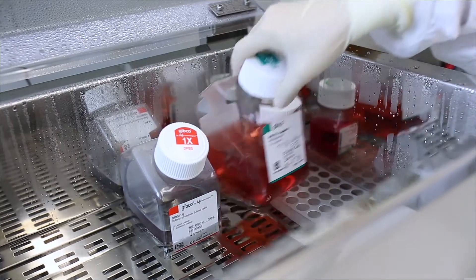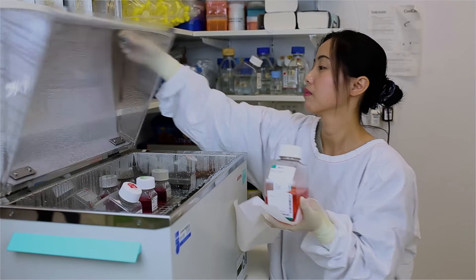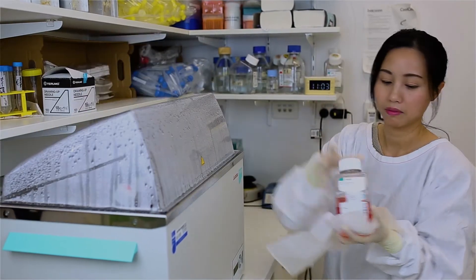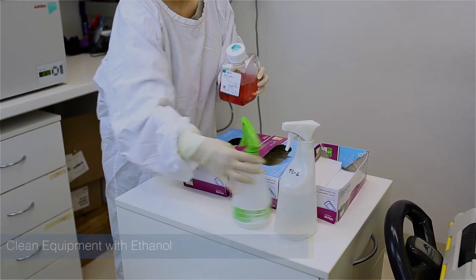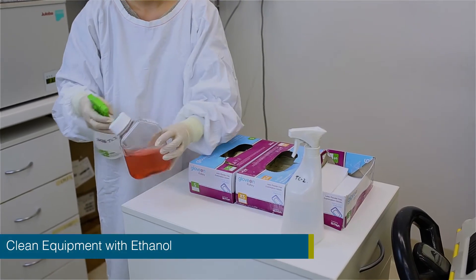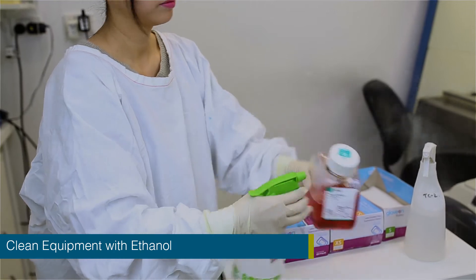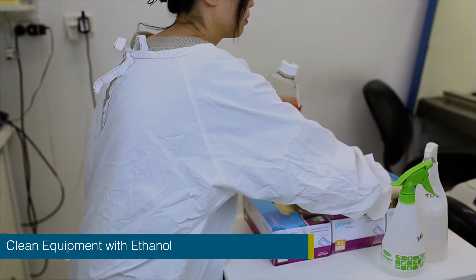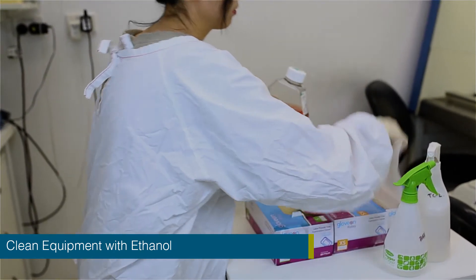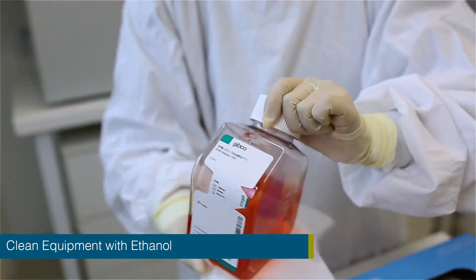The cells are cultured under sterile conditions within a laminar flow biosafety cabinet. A 70% ethanol solution is sprayed onto gloves and equipment prior to placing them into the biosafety cabinet to prevent contamination.